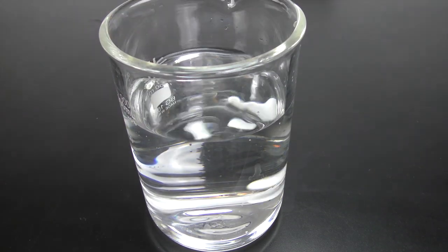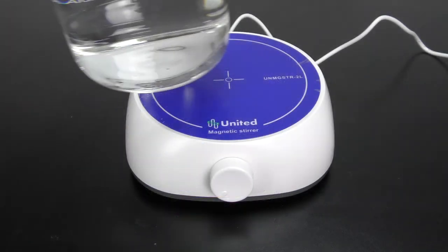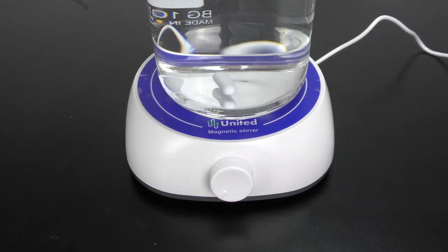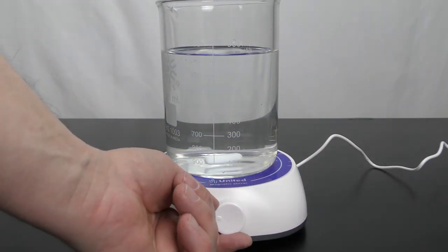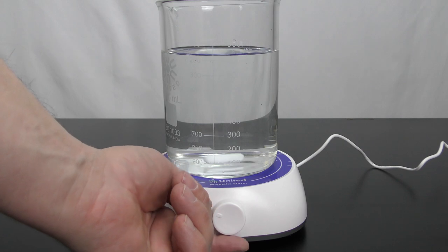Add the included magnetic stir bar. You align the beaker so it's centered on the platform. Then adjust the RPMs to your desired speed.